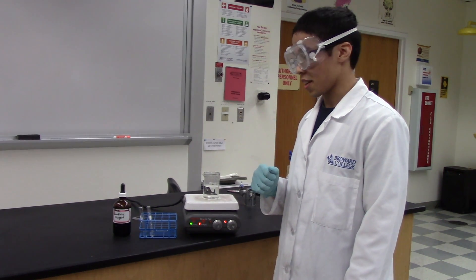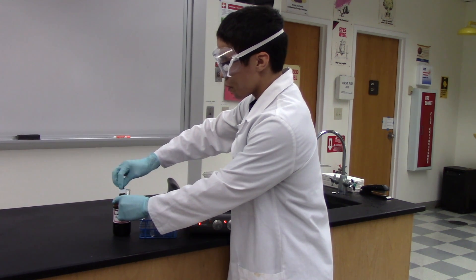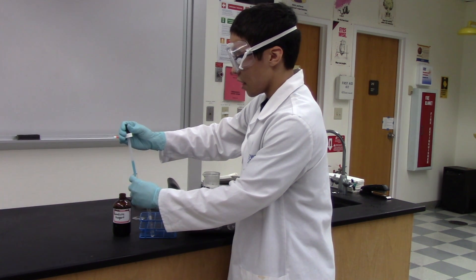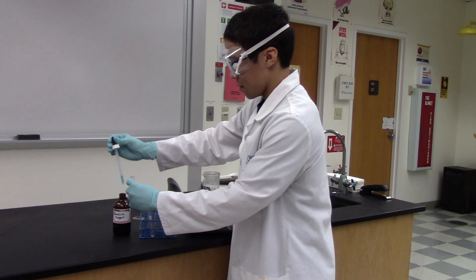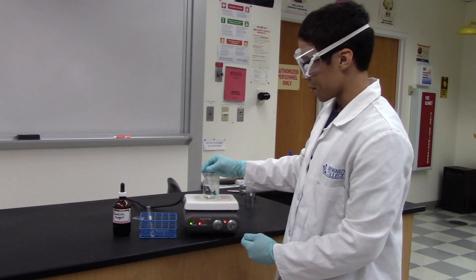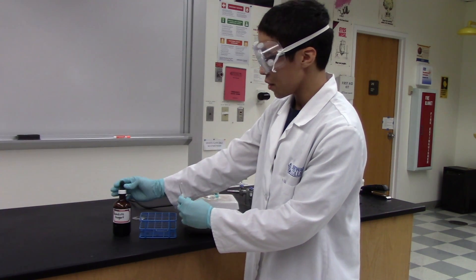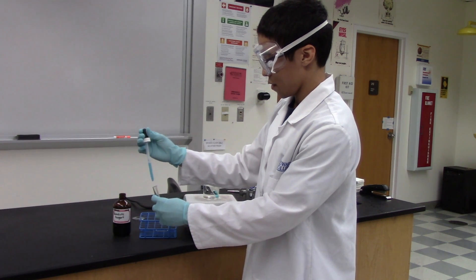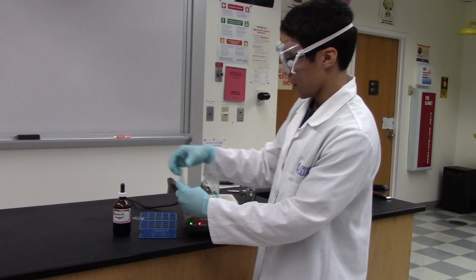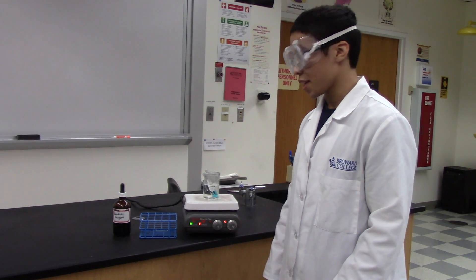To conduct the Benedict's reagent test, you will first start by taking one of the test tubes and adding about 20 drops of the Benedict's reagent. Notice that the Benedict's reagent is a blue color. You will then submerge the test tube in the beaker, and do the same for the second test tube and submerge it in water. Allow the water to boil to get an accurate result.